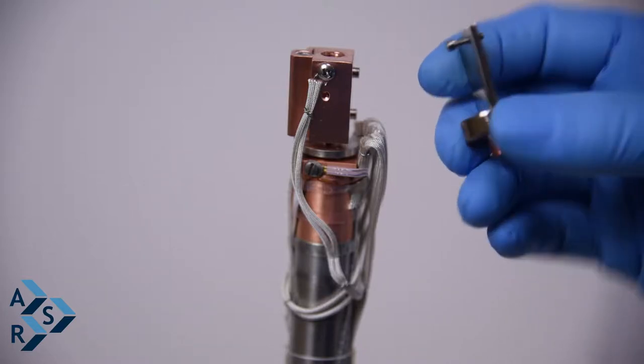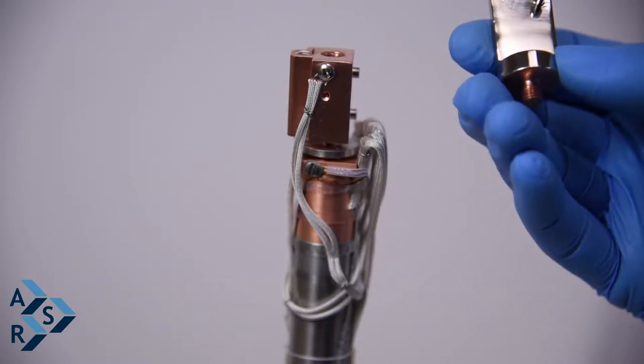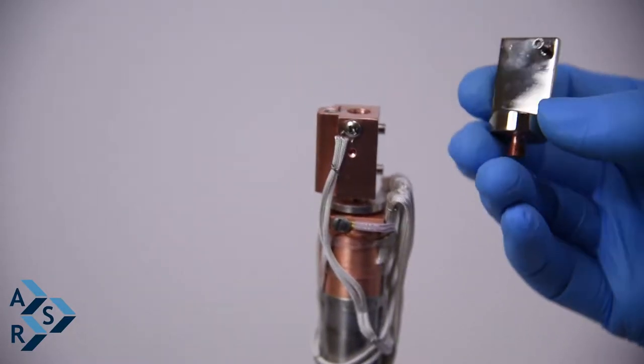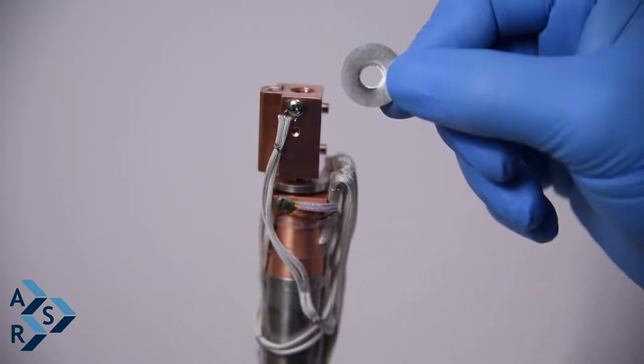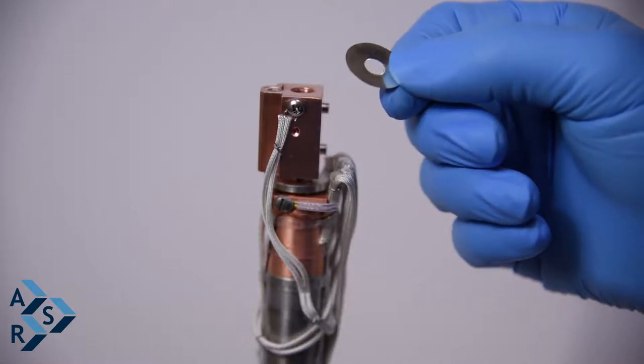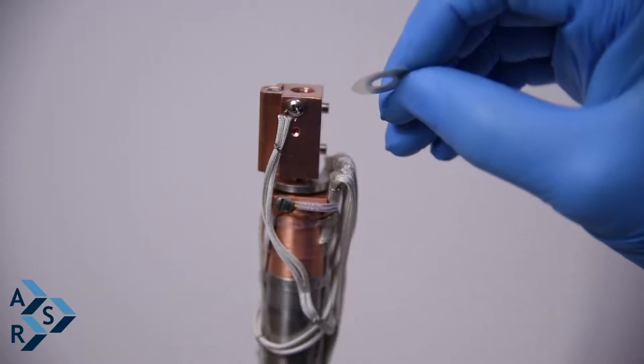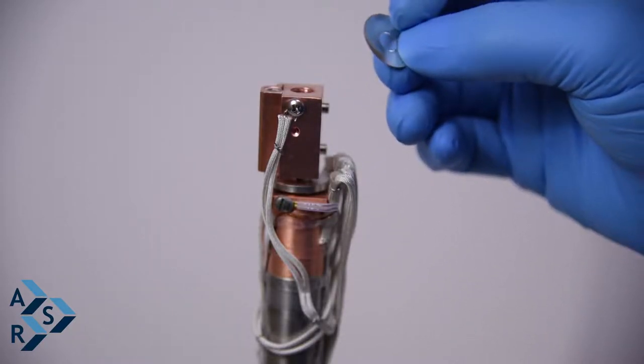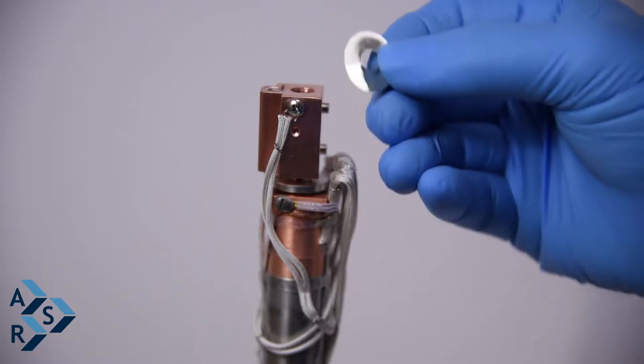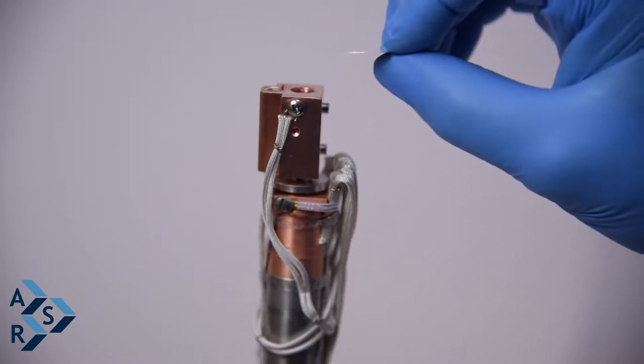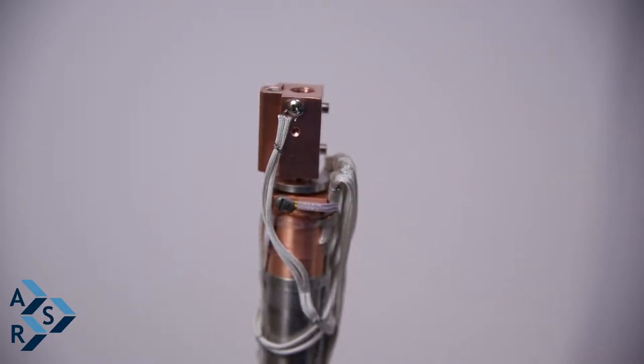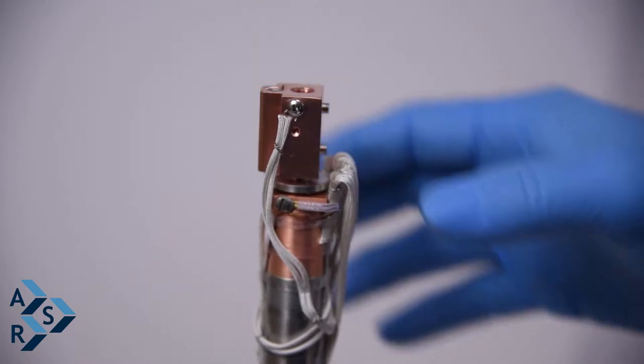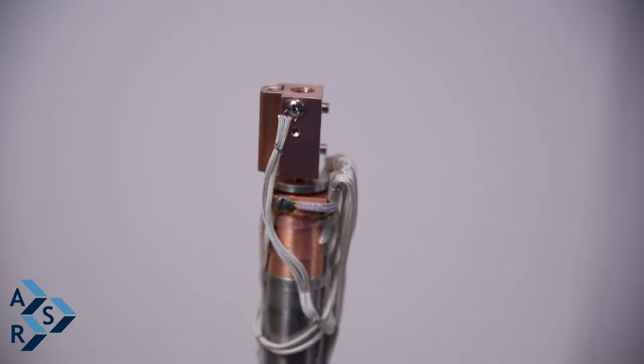This particular interface is a Raman interface. This is the gasket that we recommend. It's made out of silver. I want to let everyone know: to avoid any unforeseen circumstances, do not use indium between your sample and the interface because it will melt all over the interface and damage the system.